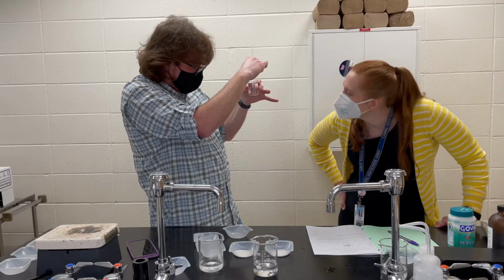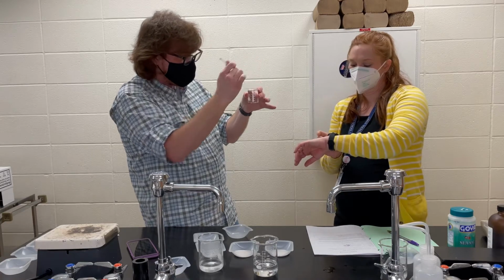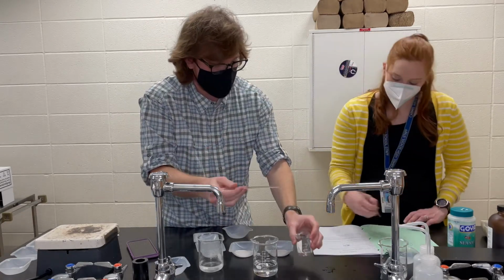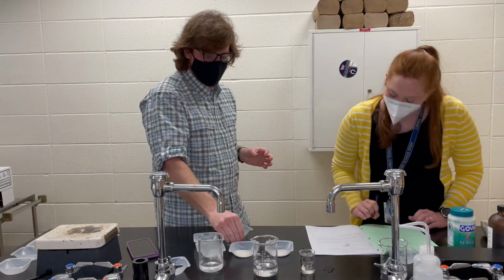Okay, I think that's it. Looking pretty good. I'll call it 326. 326, and my arm's not sore at all. Actually, that's what's crazy.